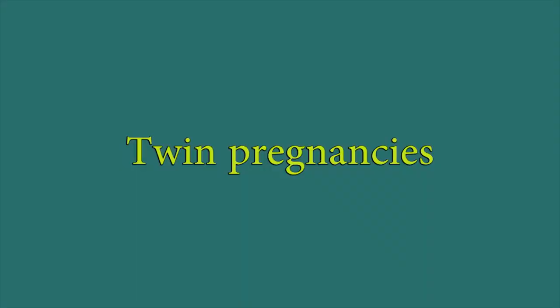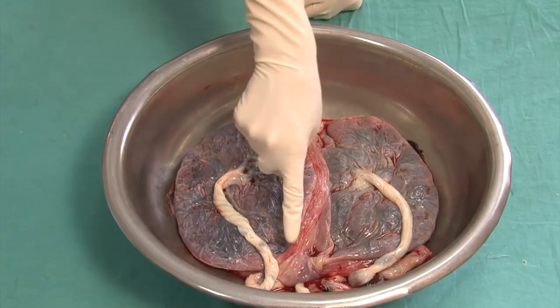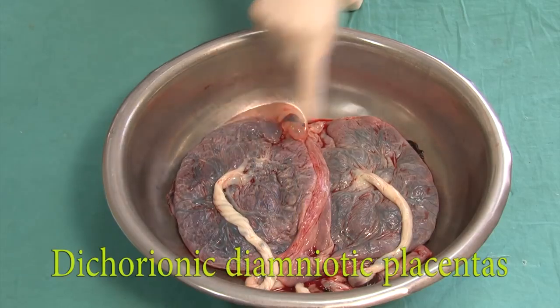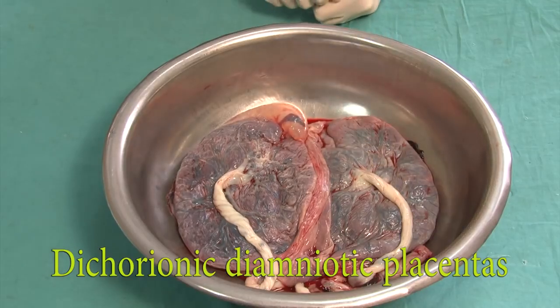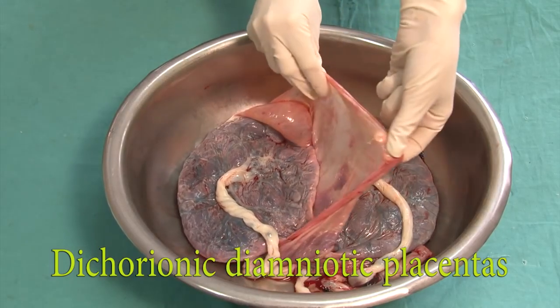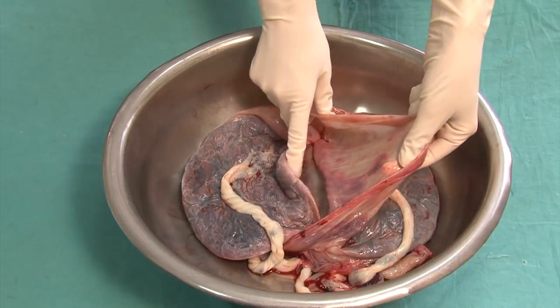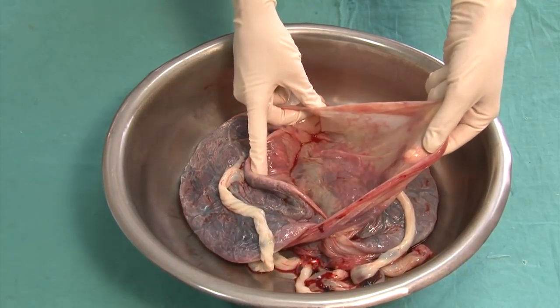In the following, the placentas of twin pregnancies will be shown. The placentas of twins can present in various forms. Here are dichorionic diamniotic placentas, each one having its own umbilical cord, which inserts more or less centrally. When examining the membranes, one can see how they divide the two placentas and separate them from each other.